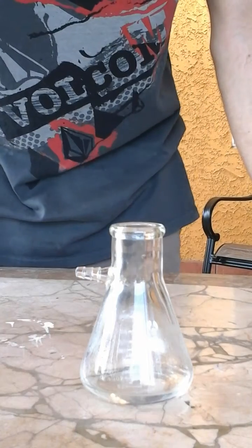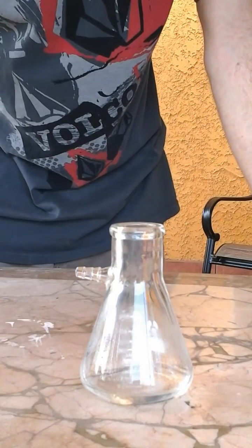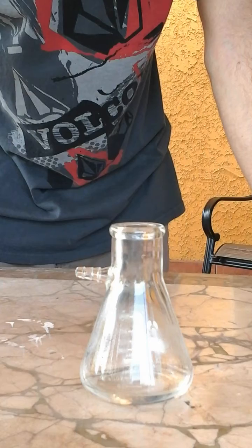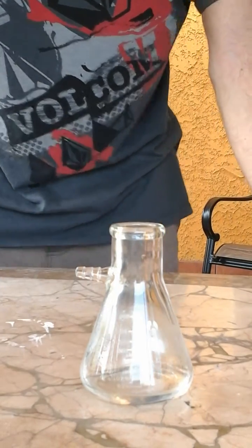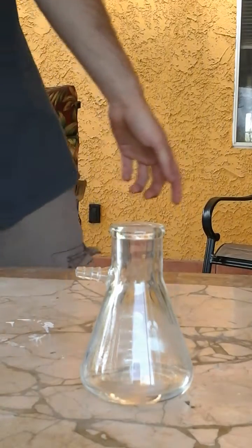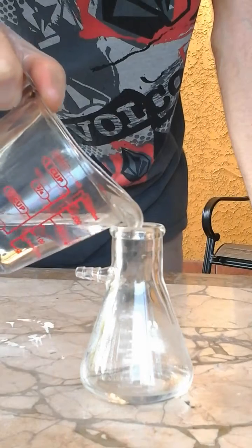This Erlenmeyer filtering flask can hold up to 100 milliliters of liquid. The first thing I'm going to do is add 50 milliliters of formic acid. The rule of thumb is to put two parts formic acid for every one part of sulfuric acid.